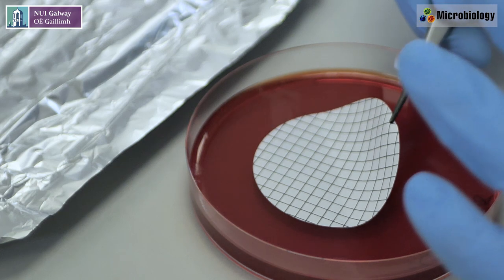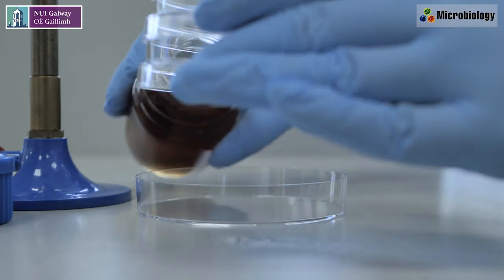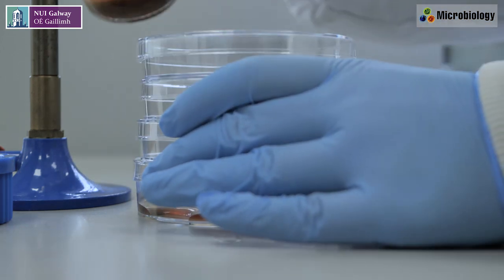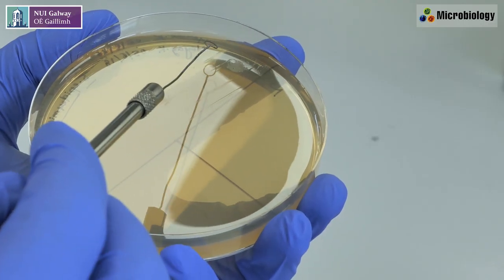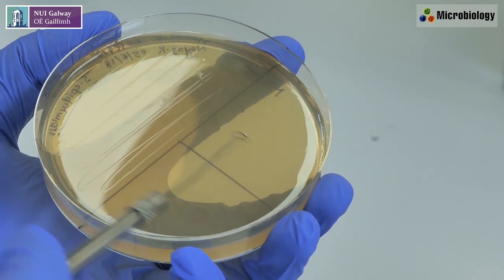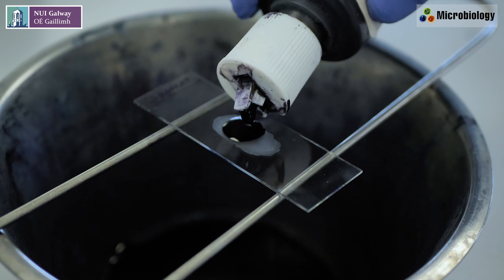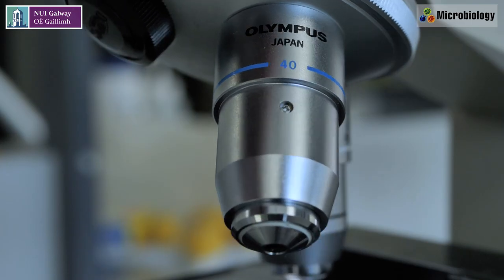They include some of the most basic methods used in working with bacteria, such as pouring agar plates and growing bacteria by means of a three-way streak, staining bacteria for identification and viewing them under a microscope.